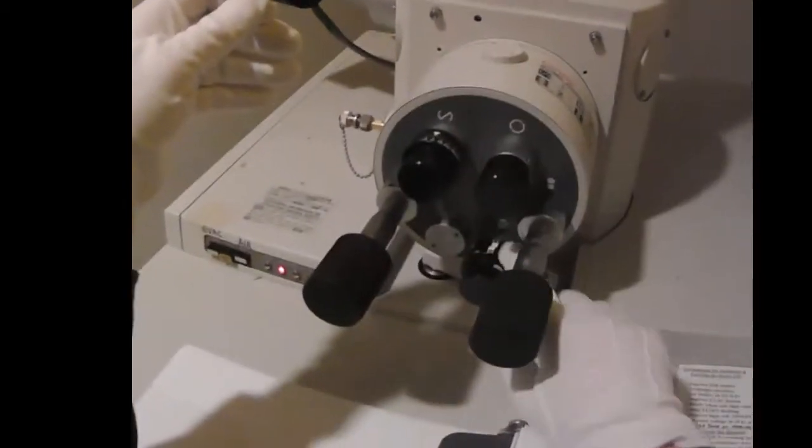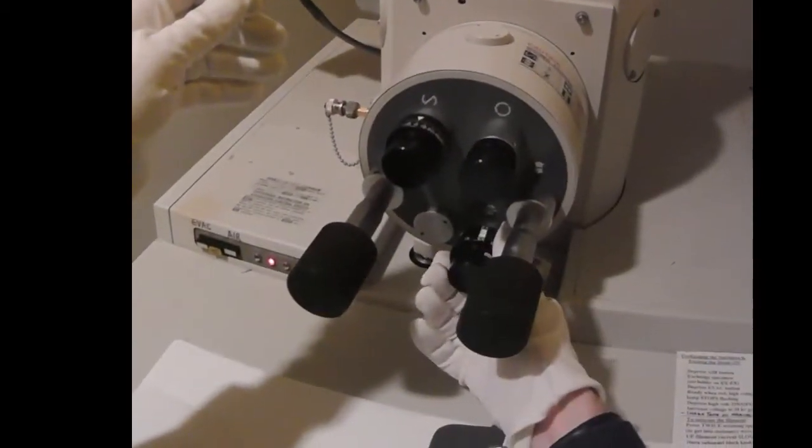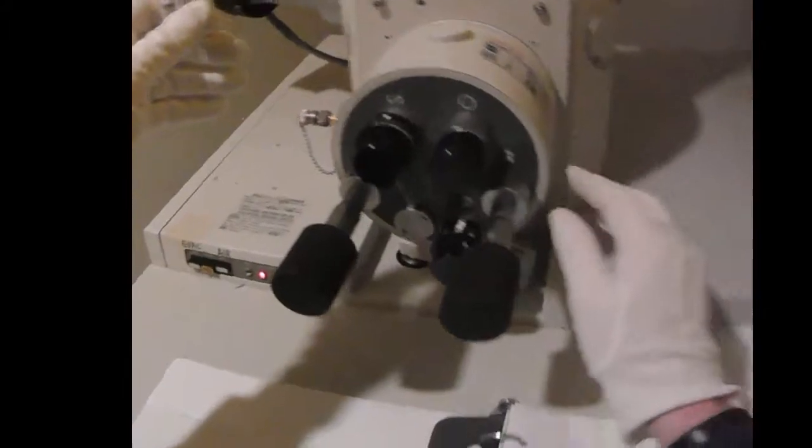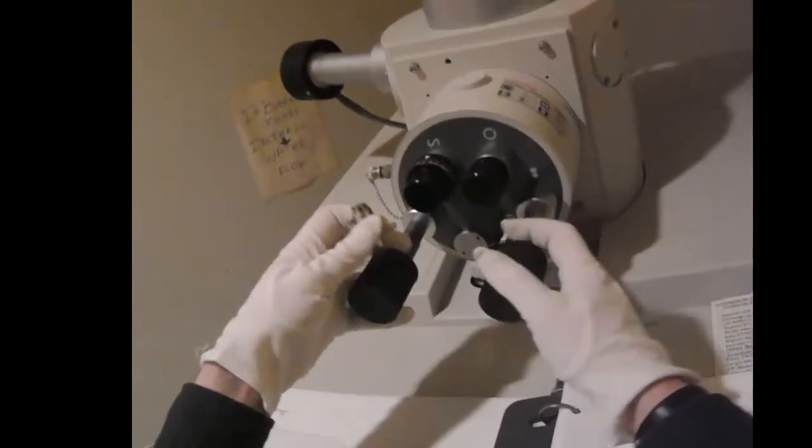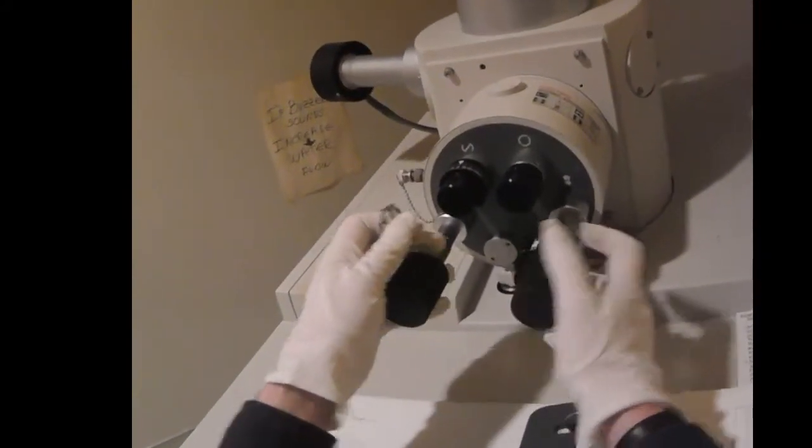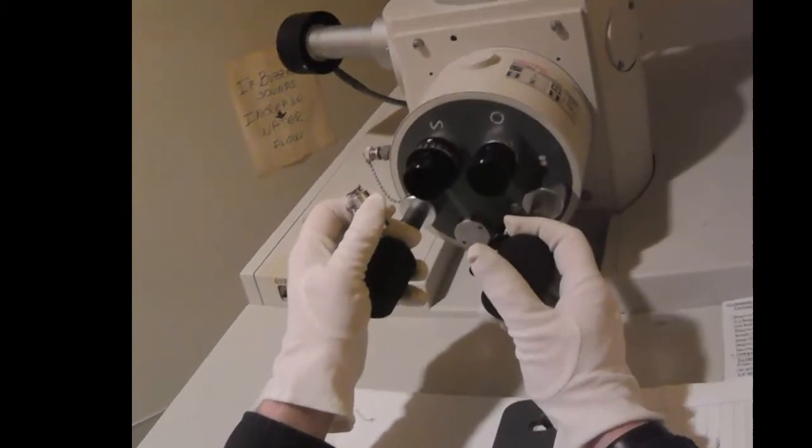Make sure all these knobs are in the right position. Then we can pull this open gently once the vacuum releases.